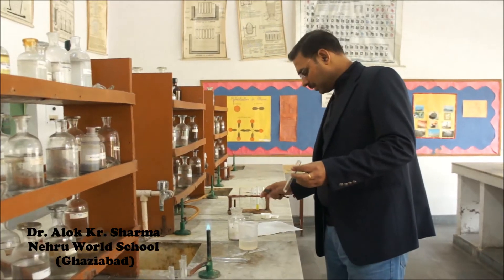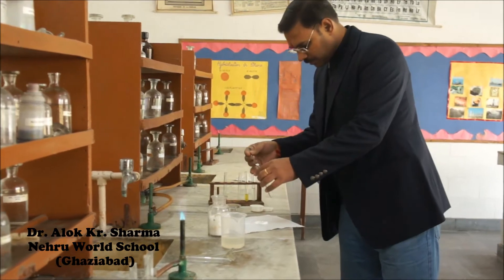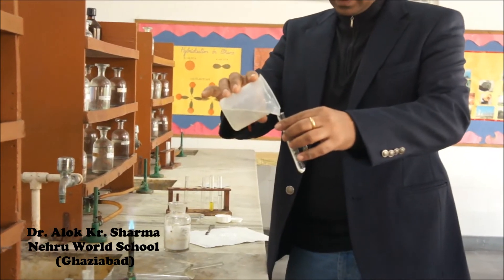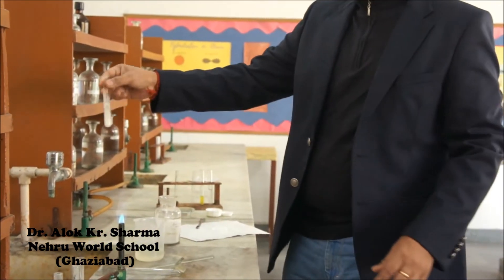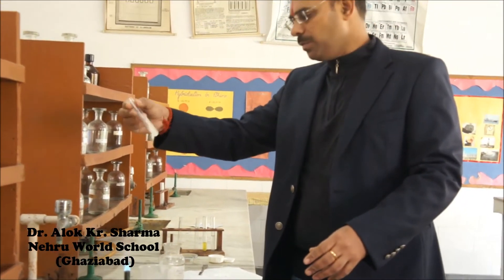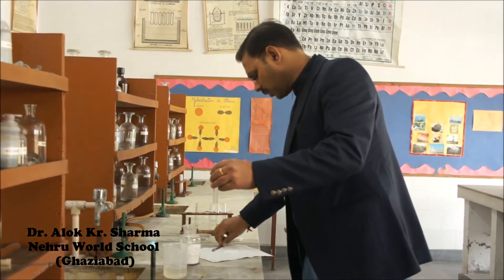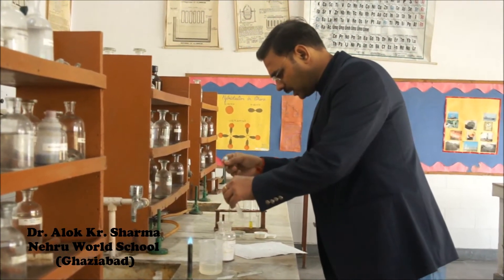In calcium, we take the salt of calcium and water. After that, we add the group reagent for that group. The group reagents are: NH4Cl, NH4OH, and ammonium carbonate. So first we add NH4Cl.